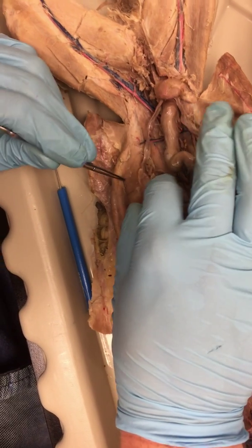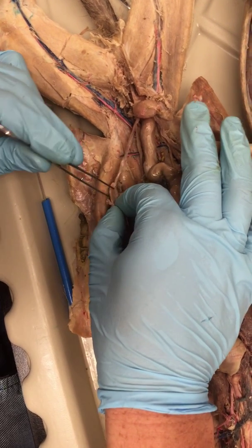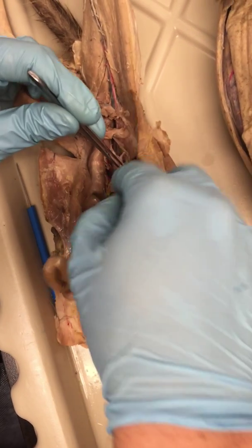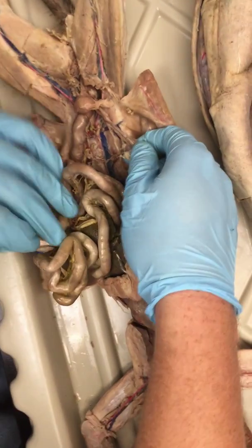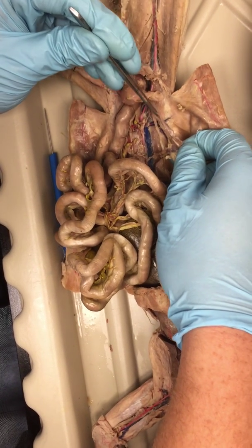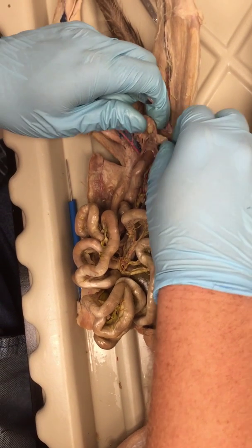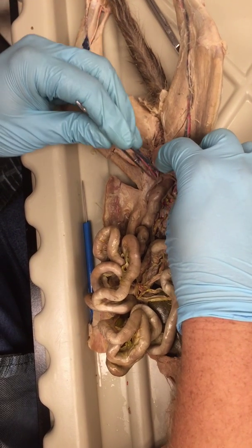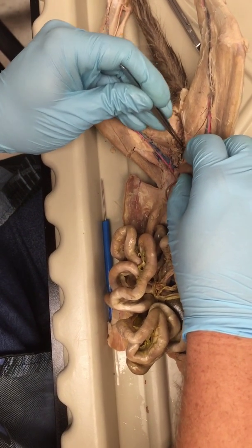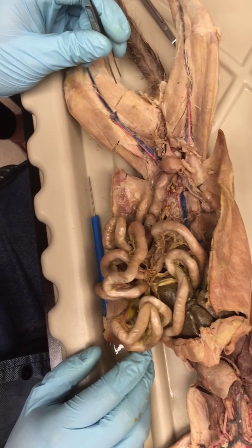Now this is a female, so you're going to see female anatomy. Here, this big old circular structure that is not very well dissected. Let's see if it's dissected on the other side. Big old circular structure. There it is. This is the ovary, and it's connected to an oviduct. And then this is the uterine horn, also known as the uterine cornu. Comes down here to the body of the uterus, which is right here. It's a triangular structure. And then the vagina is down here next to the urethra. All right, that's all the organs of the lower body except for the male dissection, which I don't have with me right now.